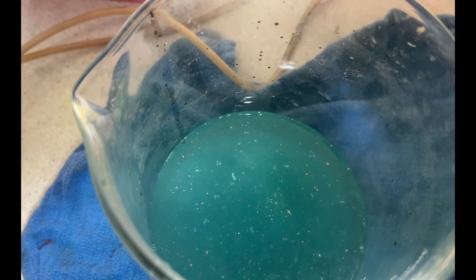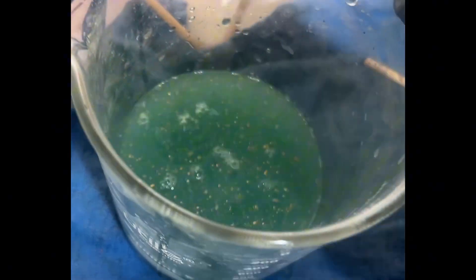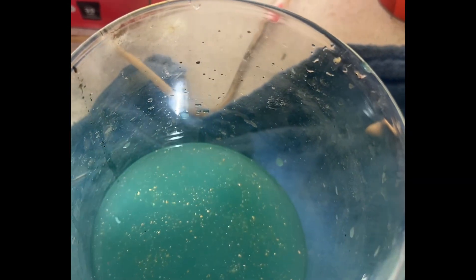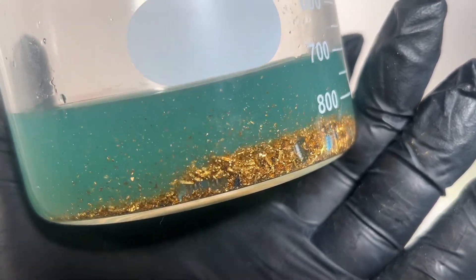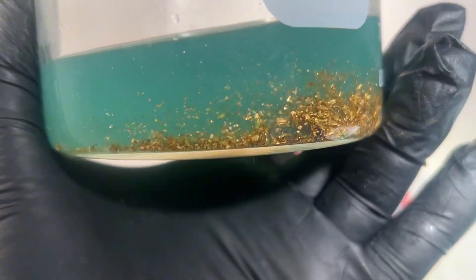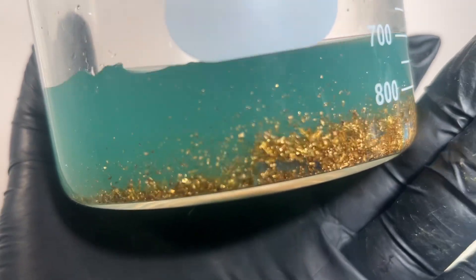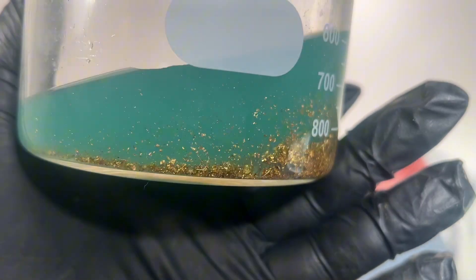I'm going to put some circuit boards in there next. Looks pretty good. We're going to decant this off — a lot of those foils are coming out. We'll filter this off and then reuse the water again. It's just a little bit, but it's recovered. The whole point is it would have gone to the landfill, but we're going to recycle it — a little bit of urban mining today.